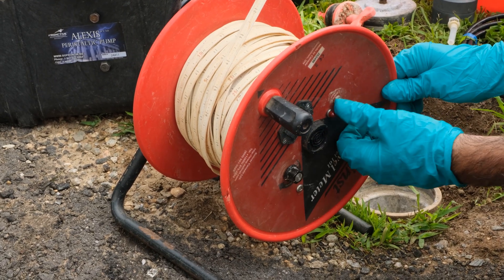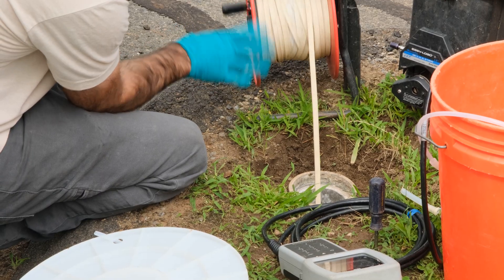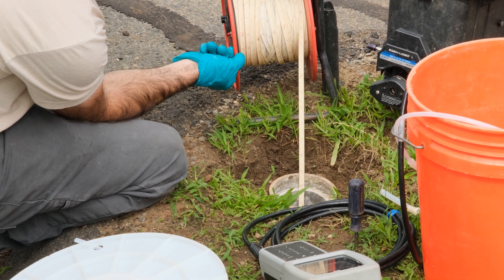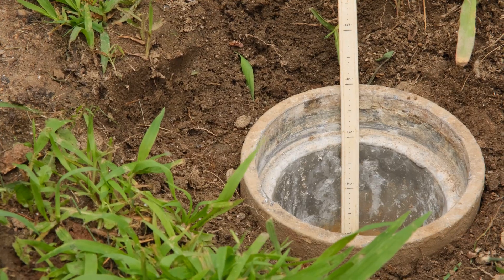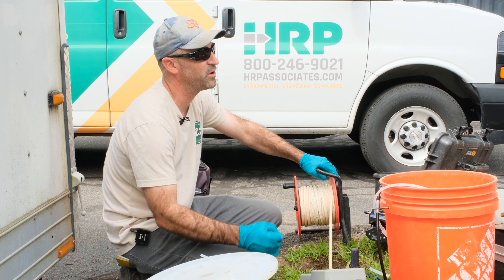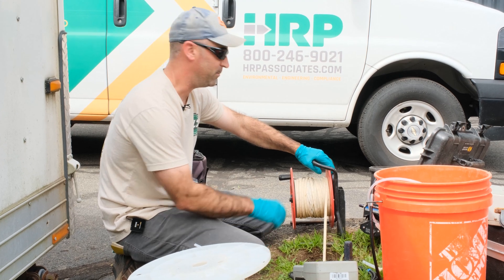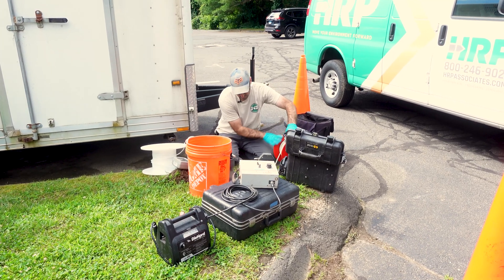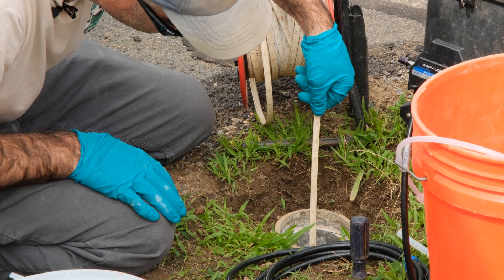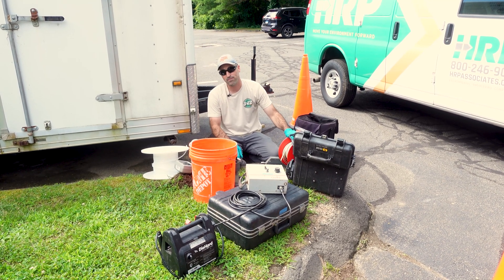Make sure your meter is turned on and test it. The depth of water in this well is 10.03 feet. To determine your set point for your tubing you need to know the bottom depth of the well — you can go off previous data or the drill logs. The depth of bottom of this well is 16.83 feet, so we have 6.8 feet of water.